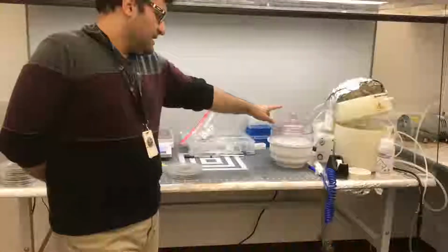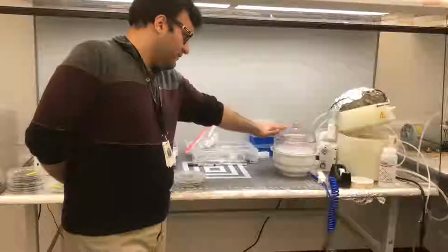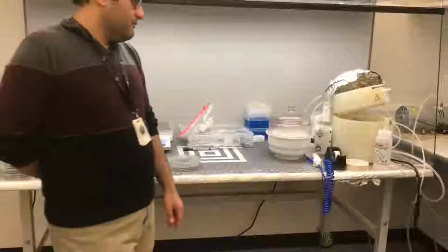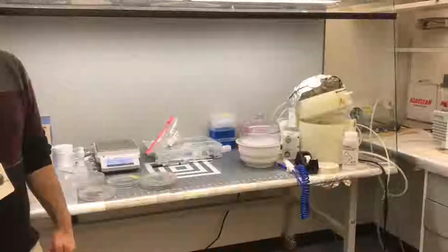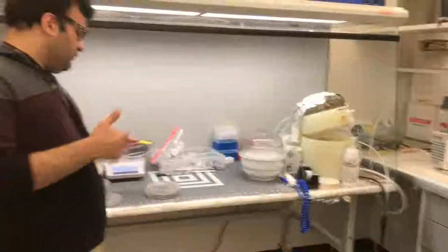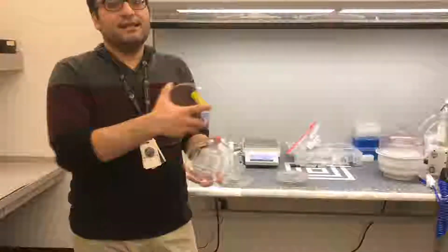Okay, in a cup, if you put more than 40 gram, you see it creates foam. When it makes foam, the foam goes above the cup, in vacuum. In the case when you have to make as many as four cups, for example multiple, or for the first time when you want to make the whole PDMS, you need at least around 70 gram, 60 gram.